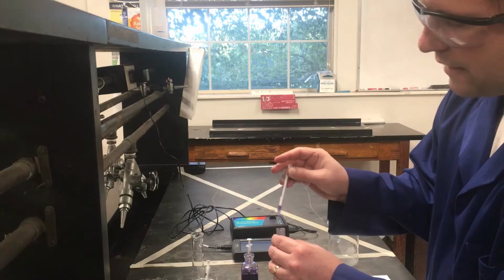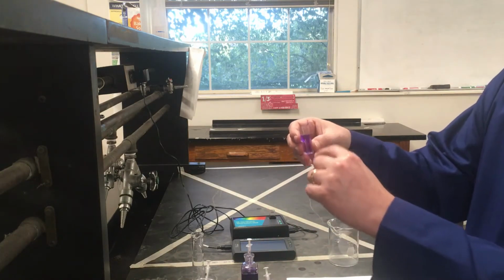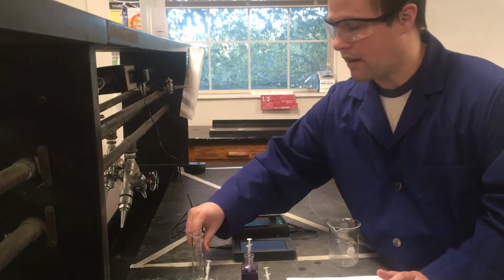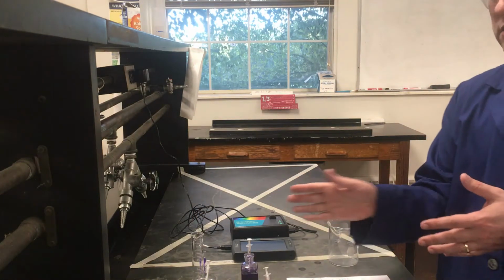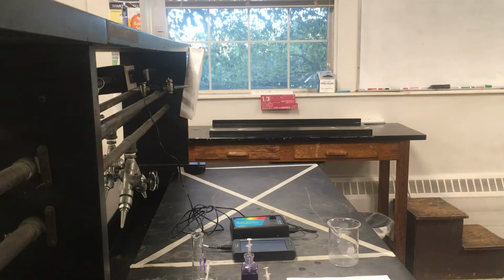And so notice I don't have the cuvette filled all the way to the very top. That's fine. Everything of where the measurement's going to be made is already covered, so I don't really need to worry about adding more. Now, if I wanted to be really careful with this, if you want to avoid getting fingerprints on it, like I might have just a second ago, we do have things called Kim wipes that we can use to wipe these off.